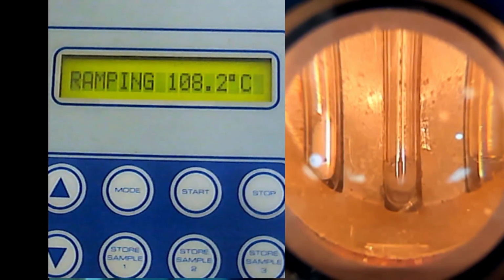Now it seems another sample has melted, but we need to know what our unknown is. We know that at the first experiment, the first test of our unknown, it melted at a certain temperature. So you need to make sure that whatever is left now will melt at that temperature. Then you can be sure that your unknown is that substance.